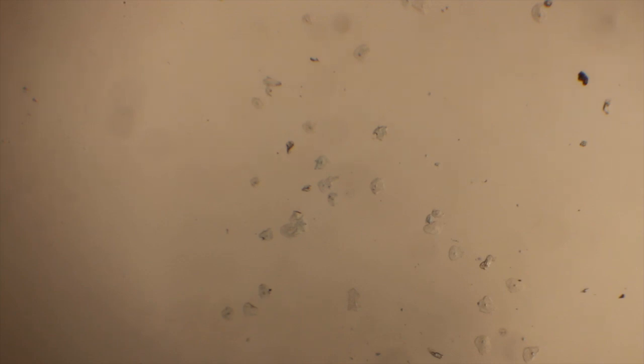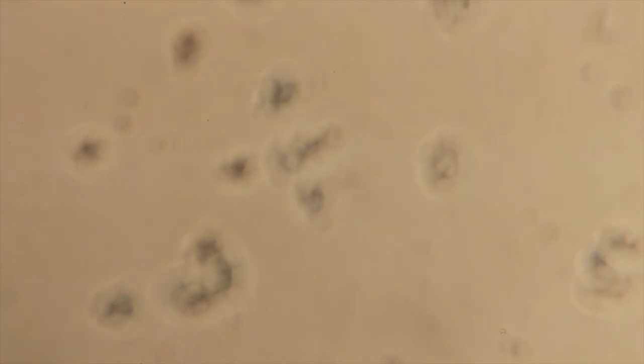Okay, now we want to look at the cheek cells. So here's a view under the 4x magnification of the slide that we just made with the cheek cells. These cells are stained with methylene blue. We can see little itty bitty teeny tiny cells in there, and each of them have a little black dot. That little black dot is the nucleus. I'm going to shoot up under here the 10x. We can see them a little bit better.